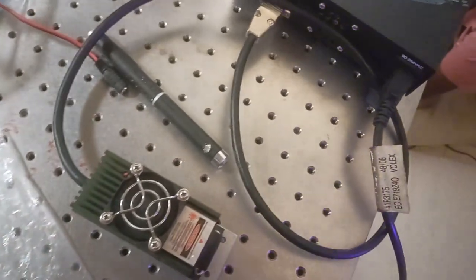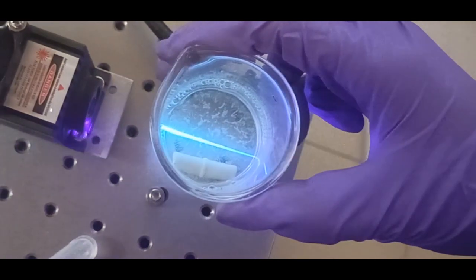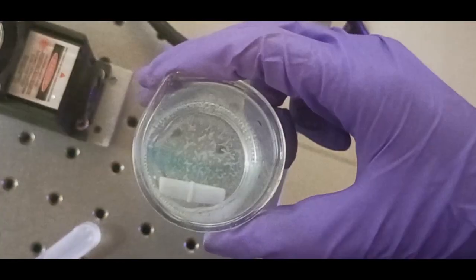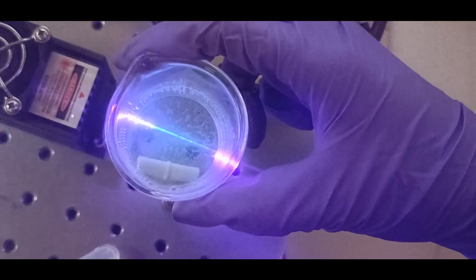If you see there is a slight blue color which actually changes. So we can do one thing, we can see from the above.